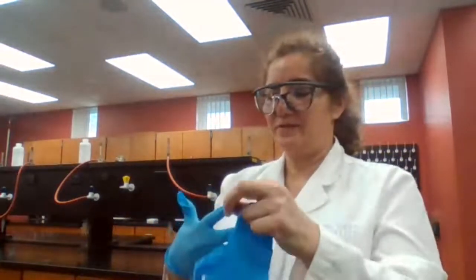One rule in the lab: when you are using gloves working with acids, if your gloves change color, if they turn yellow, you need to change your gloves. That means you have some chemicals or acid on your gloves. You don't want to touch your skin with contaminated gloves. There are only two sizes of gloves here in the lab right now. I should get another box of a different size, because it's either small or extra large.